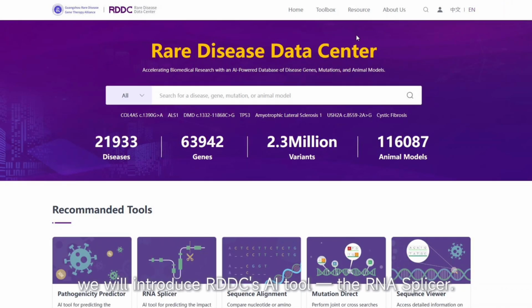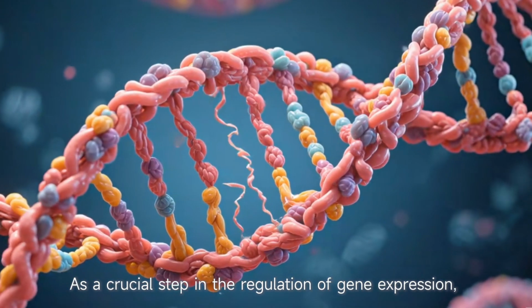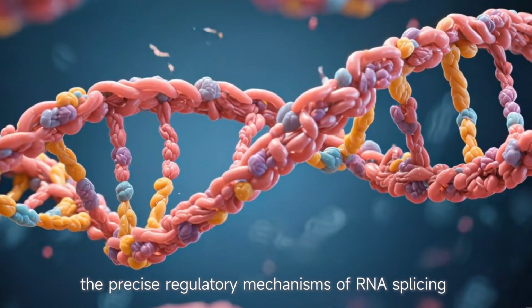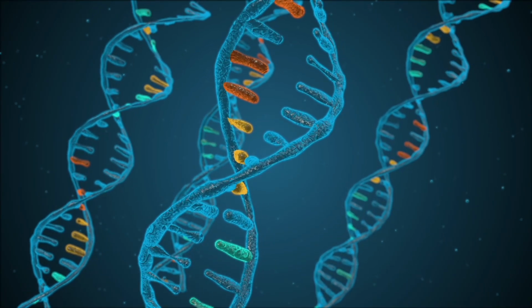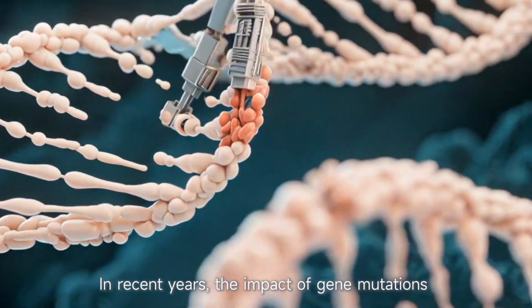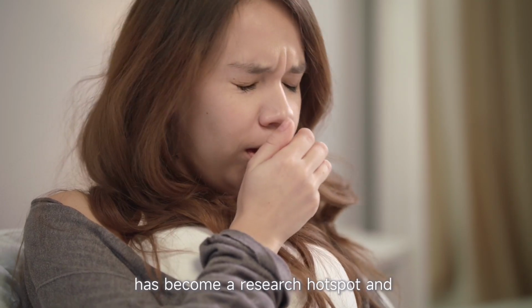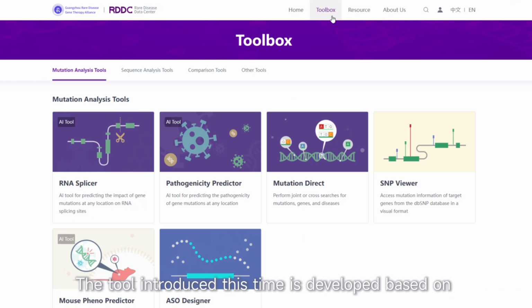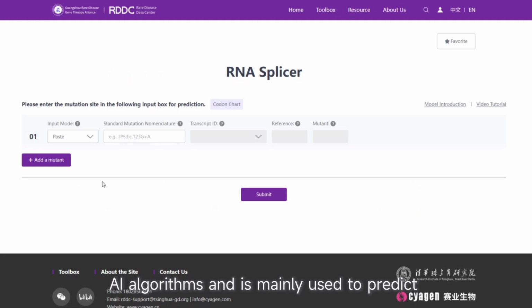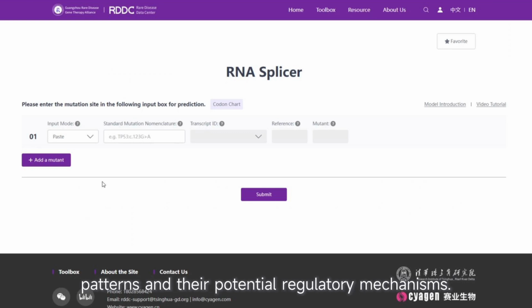We will introduce RDDC's AI tool, the RNA Splicer. RNA splicing is a crucial step in the regulation of gene expression. The precise regulatory mechanisms of RNA splicing have not yet been fully elucidated. In recent years, the impact of gene mutations on RNA splicing patterns and their molecular mechanisms has become a research hotspot and challenging issue in the field of biology. The tool introduced this time is developed based on AI algorithms and is mainly used to predict and analyze the impact of gene mutations on RNA splicing patterns and their potential regulatory mechanisms.